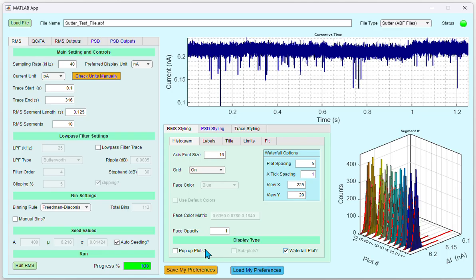For the waterfall plots, you can also change the plot spacing, X-tick spacing, and the view angles of X and Y. If you want pop-up plots, you could click the Pop-up Plots radio button option. The Subplot option becomes available when Waterfall Plot is deselected.